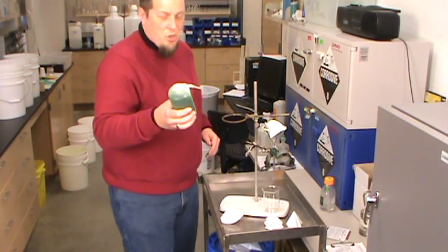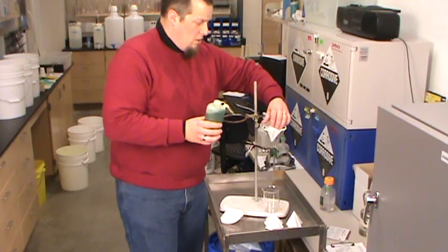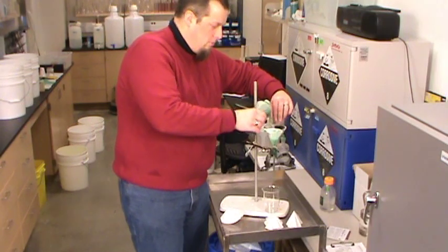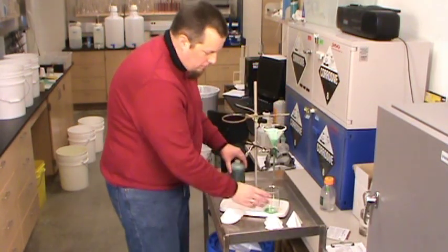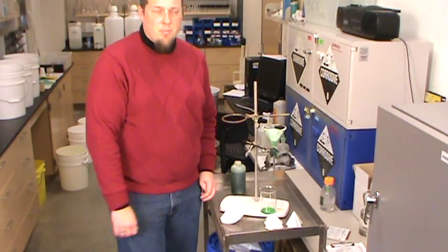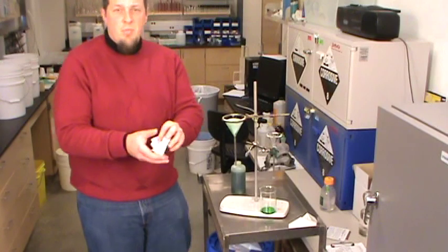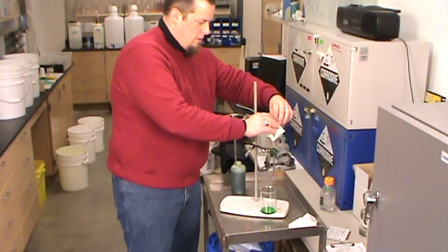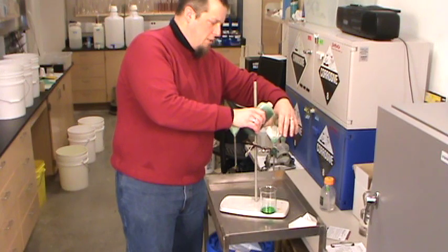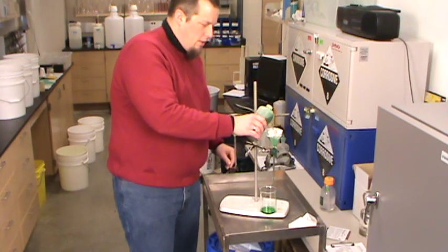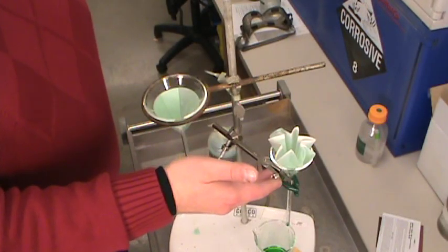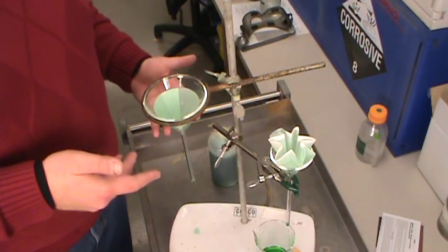This is just some green water. I made it green so it's easier to see. My filter paper is popping out. If I wet it down, now it's stuck to the walls - it doesn't pop out anymore. Same thing holds true if I'm using a fluted filter paper - it's a little poppy, but once you get some liquid in there and get it wet, it'll settle down pretty nicely.